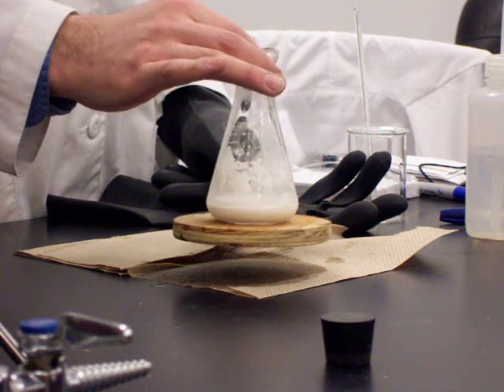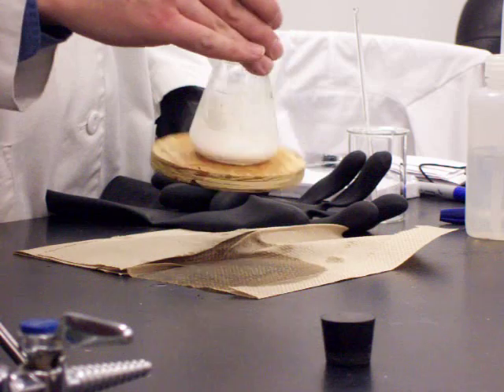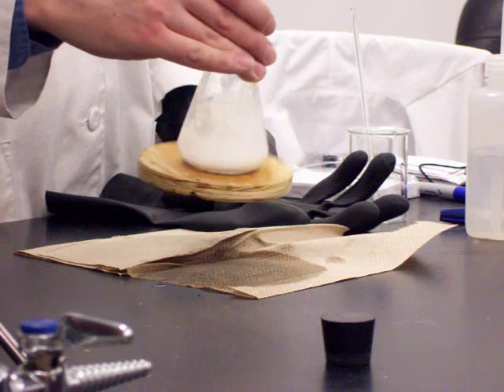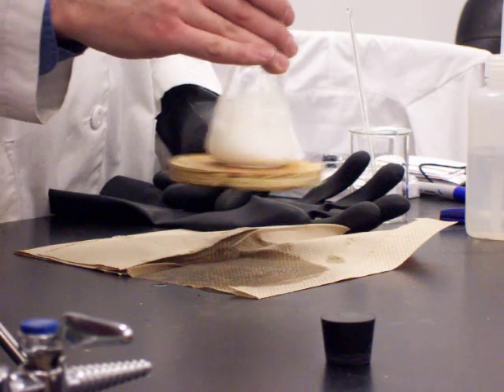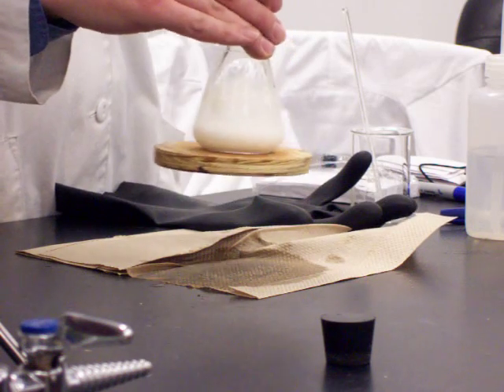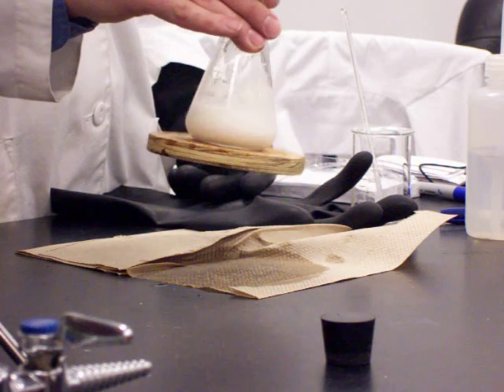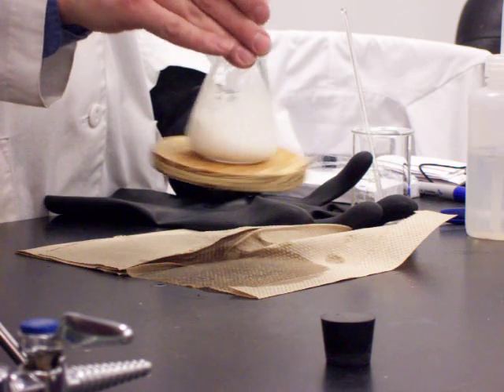I'm able to pick up the wood. If you look inside, you can see that it's definitely a fluid in there — a slushy liquid — which means our products are liquids. We took two solids and created some liquids. Probably, since there's the hydrate in the barium hydroxide, we created water, and then the other products are going to be in the aqueous state — dissolved in that water.